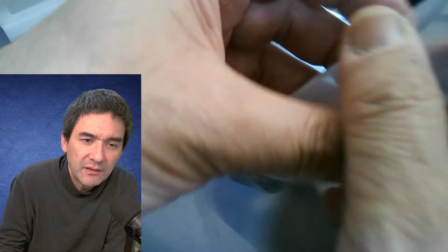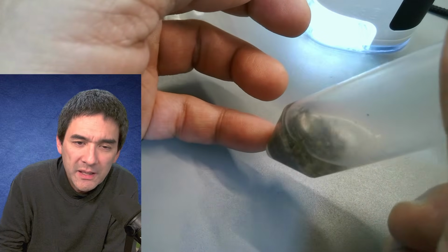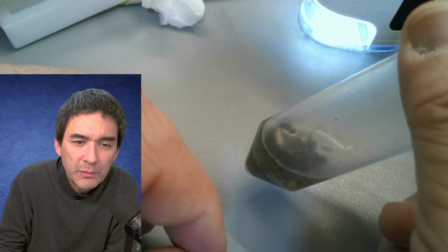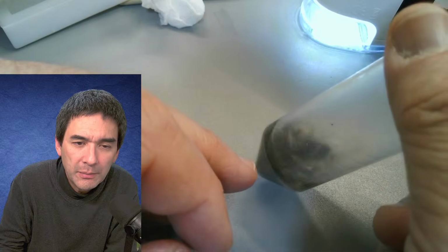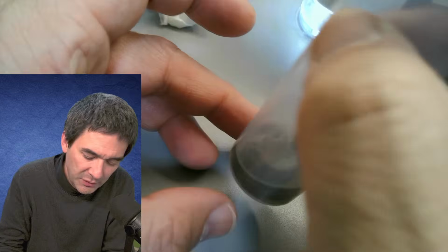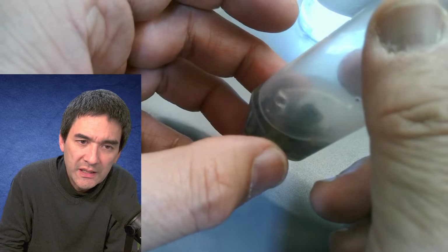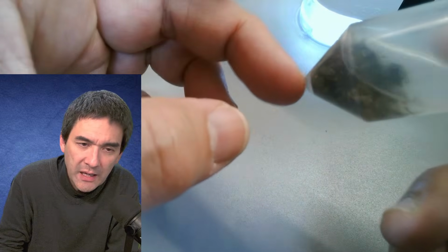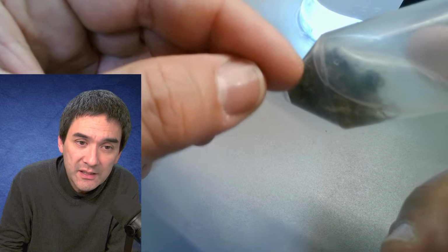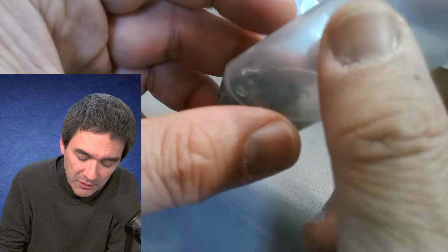So the process can be sped up much more if you put it into a warm water bath. And if you actually see those white things here, these are tiny oxygen bubbles that are starting to appear, and they're rising up. This will now take maybe a couple of hours to be fully broken down. And then I will be adding a little bit more hydrogen peroxide, and hopefully by next week we should have a whole bunch of diatom cells, basically shells, collecting here on the bottom, and by putting them under the microscope, they look quite nice.